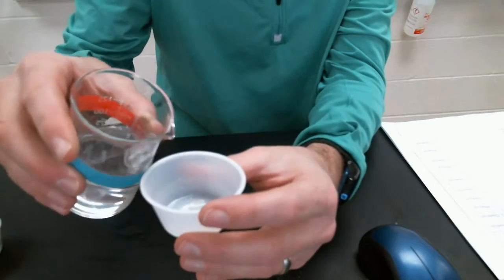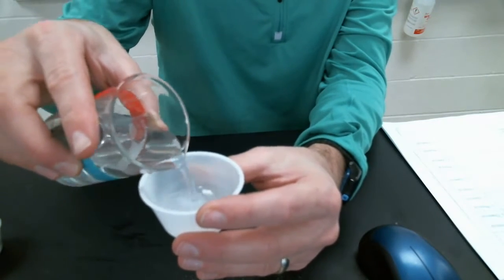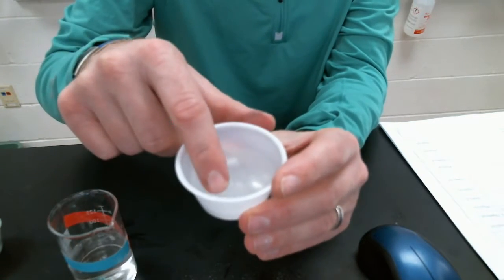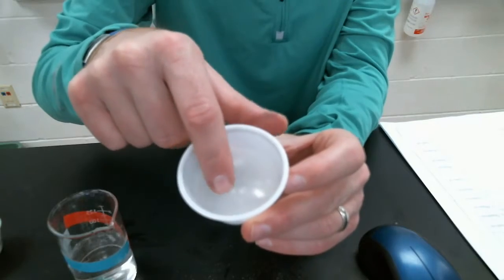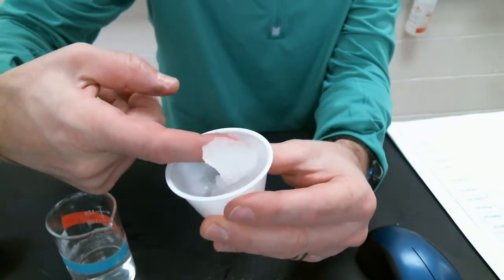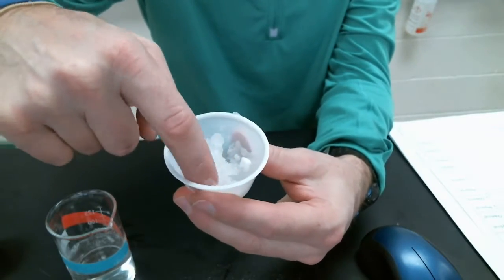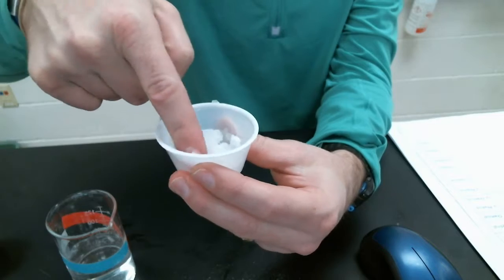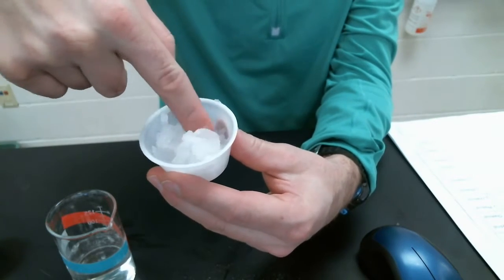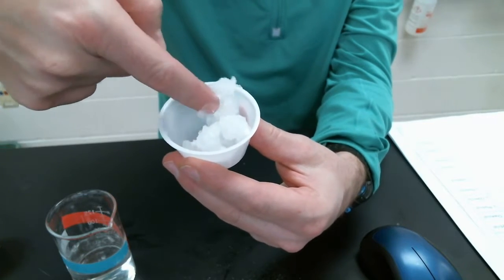And again, kind of hard to see. Add some more water. We add a whole heck of a lot of water. And again, kind of hard to see until I maybe start touching it. Now we have this kind of clear, solid, almost Jello-like consistency substance. There we go. Oh, isn't that lovely looking? So again, after we added water, it became this clear, Jello-like substance, or gel, actually.